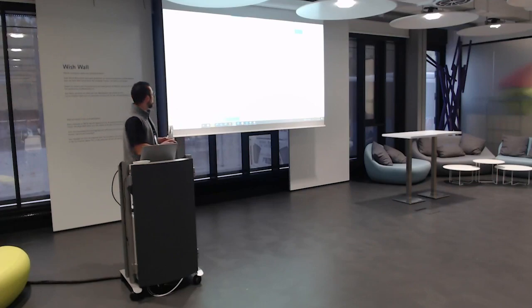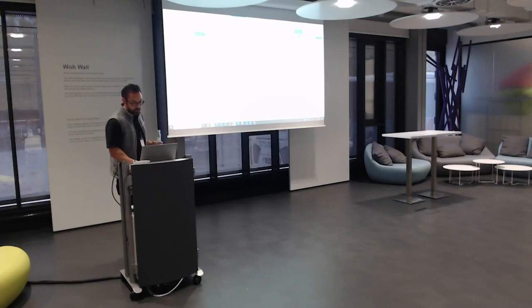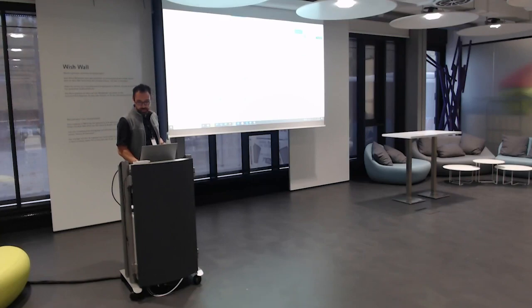For those who don't know Signals Notebook, this is an example of a template. I'm on the new experiment. I want to pick a template which is going to force me to enter a description, a name, a project, so all the important metadata for you and your company can be made mandatory or not, right? So this is an example that goes through a few clicks, creating an experiment, which in that case is very blank, actually. That's my template, to which I can add the various elements. So I'm just adding a chemical drawing into my experiment and just expanding the canvas a little bit so that we have a slightly more visible app. So there you go.